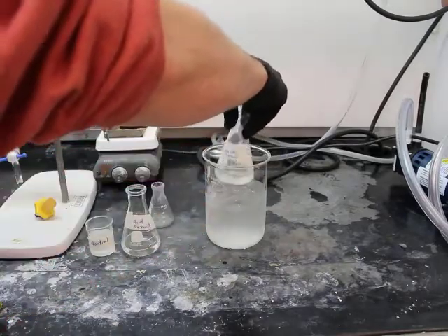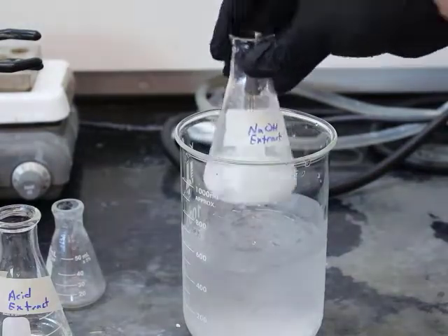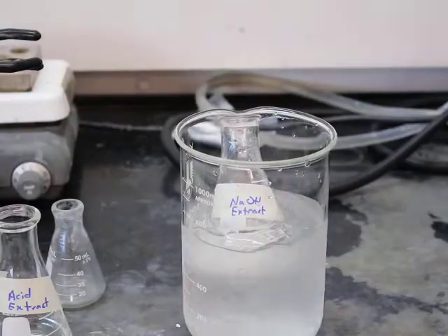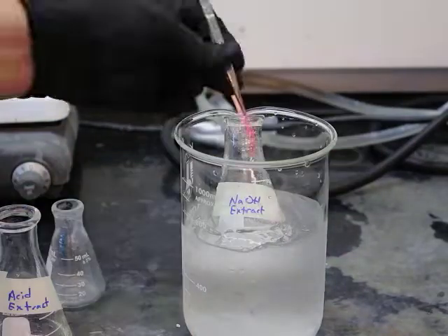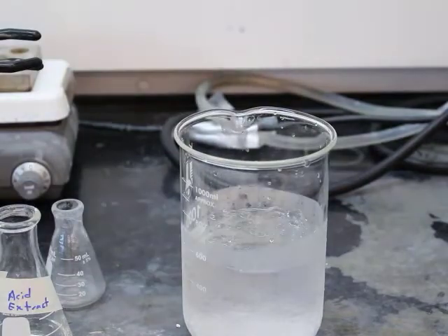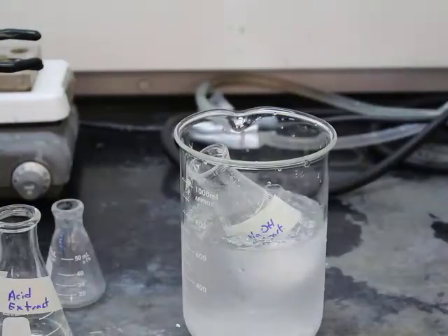All right, so with that basic extract, now adding 6 molar HCl, and we want to add that until our pH tests acidic. That pretty much allows us to take that acid that was turned into an ion. Since you're changing the pH back to acidic, it will neutralize it and you'll get a solid. And so that nice pink, fuchsia, magenta, not very great with color names, but anyway, you can tell it's sort of a reddish pink color. It did pH test acidic.